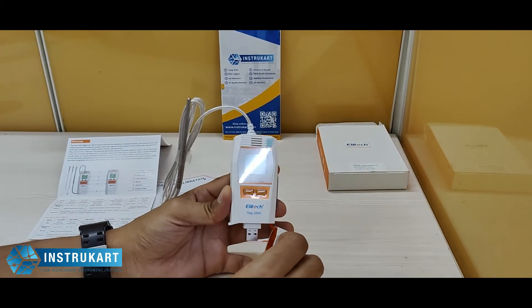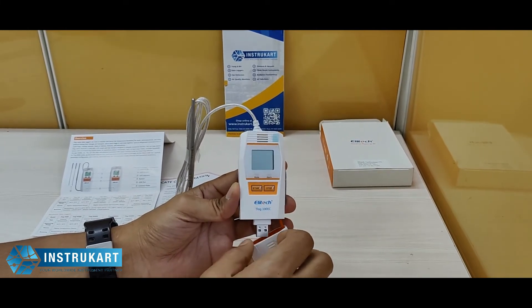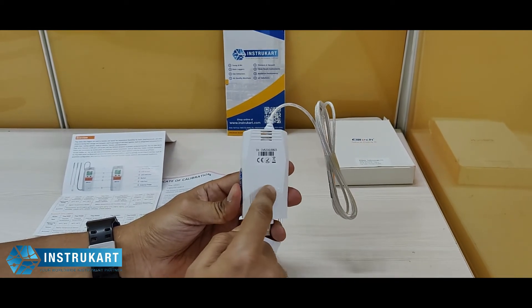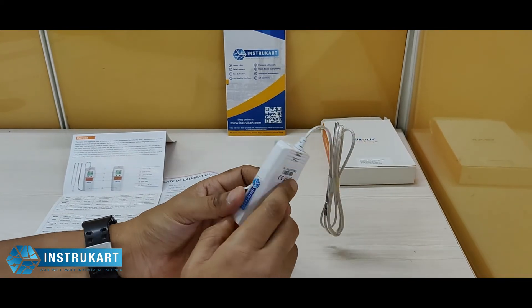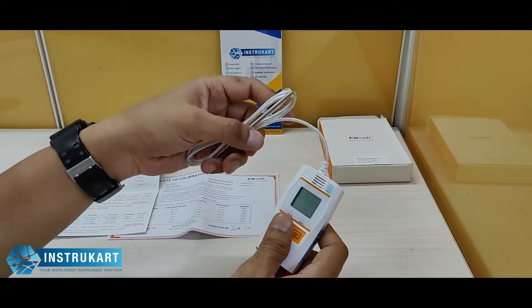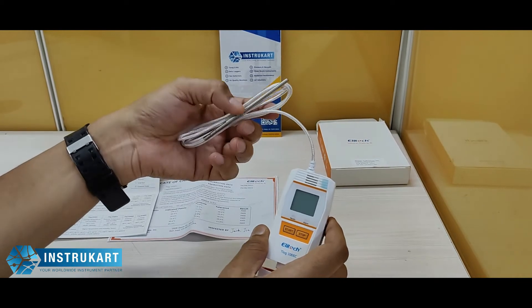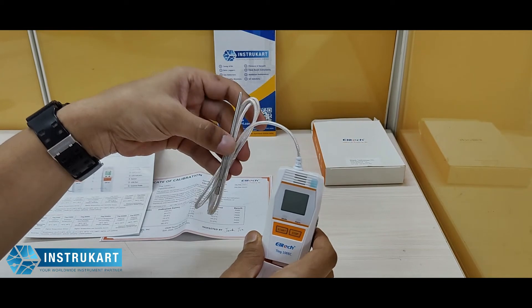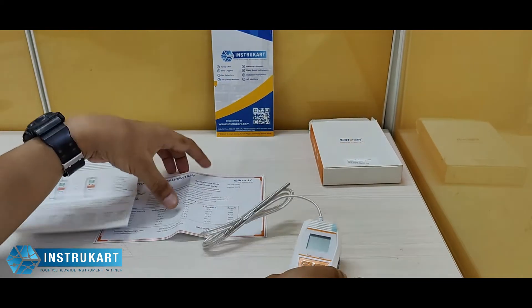Using the PC software, you can do several settings including date, time, geographical location, and many other required settings. At the back, you can see there is a coin cell required for this data logger to run. It has a robust external sensor, meaning it can be used in several applications requiring minus temperatures — such as cryogenic labs, cold chains, or environments demanding more than minus 50 degrees.